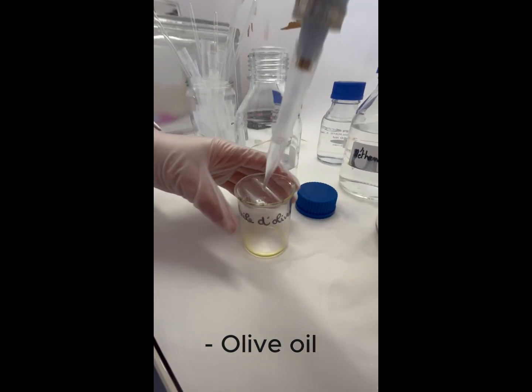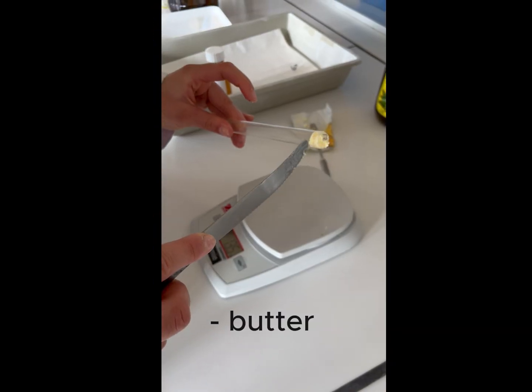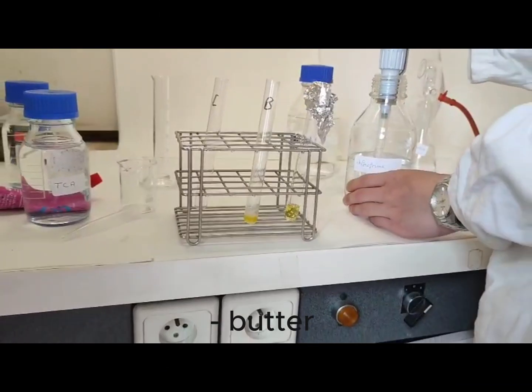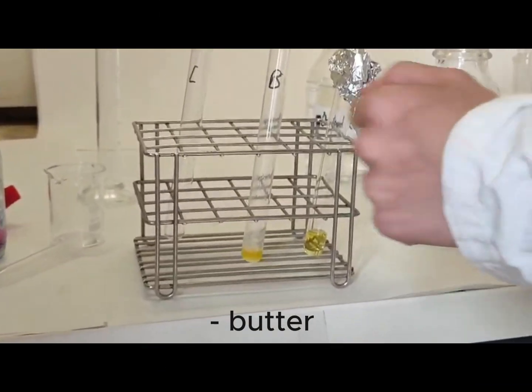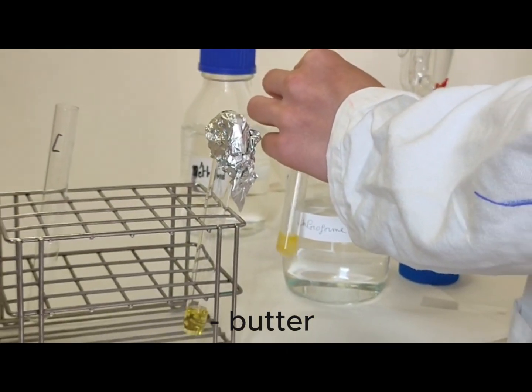For olive oil, we put a small volume that we mixed up with chloroform and covered with aluminum foil to prevent evaporation. For butter, we make it melted and mixed with chloroform, and the cholesterol indicators was pre-prepared.